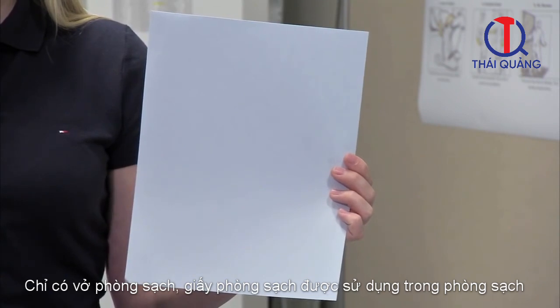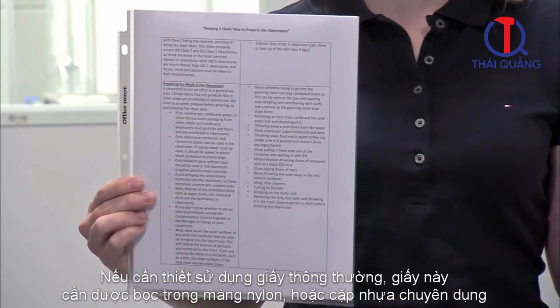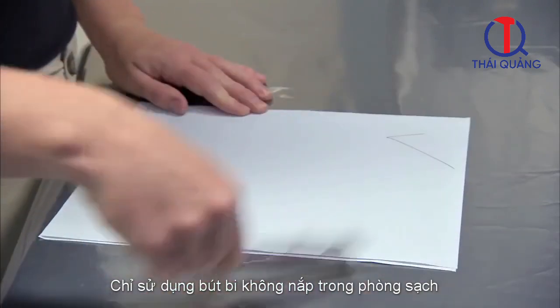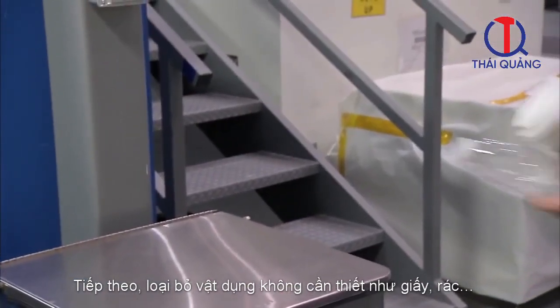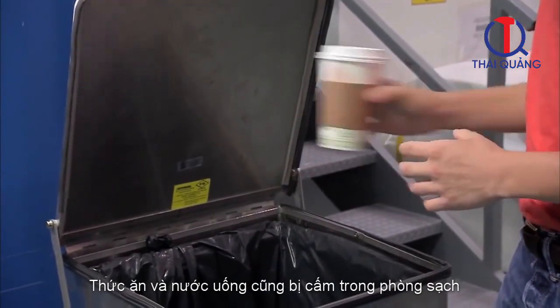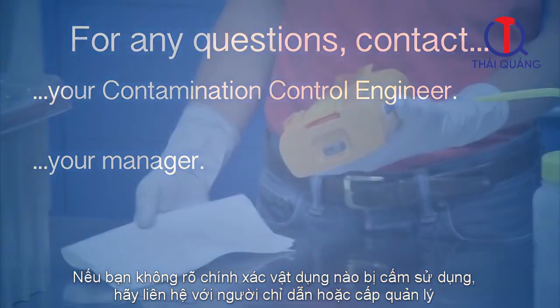Only cleanroom notebooks and cleanroom paper may be used in the clean room. If regular paper must be used, it should be sealed in plastic sheet protectors or plastic bags. Only ballpoint pens without caps should be used in the clean room. Graphite pencils create particles. Next, dispose of any prohibited items, such as paper, trash, etc. Food and drink are also prohibited in clean rooms. If you don't know whether or not an item is prohibited, consult the contamination control engineer or the manager in charge of your clean room.